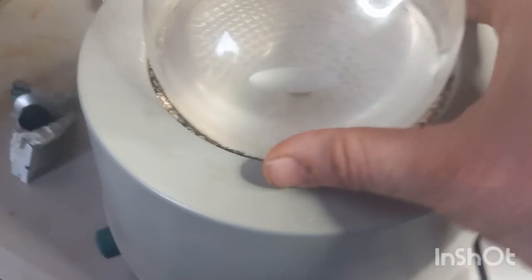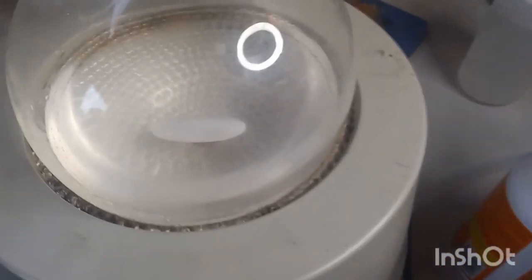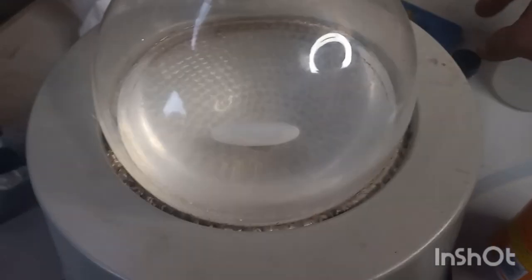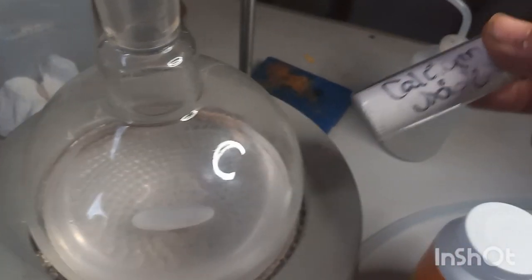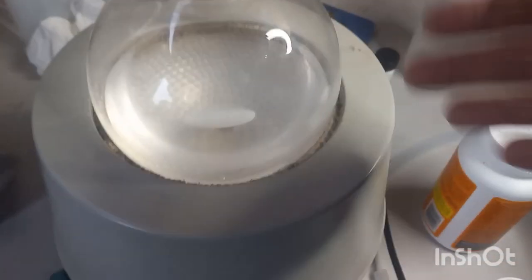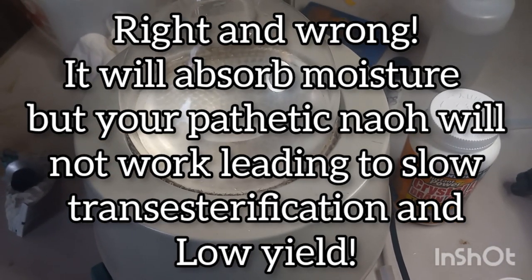There we go. So we're going to add some NaOH to this, and since my NaOH is the monohydrate, we're going to add a little bit of calcium oxide to the mix, because calcium oxide is a catalyst also. This is a heterogeneous catalyst. This is a homogeneous catalyst. This will dissolve and become part of the mixture. This will not. But I'm thinking that adding just a touch of this will help absorb the water and prevent more moisture from getting in. So we're going to load it up and see where this takes us.